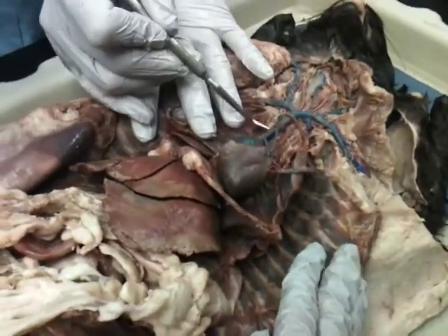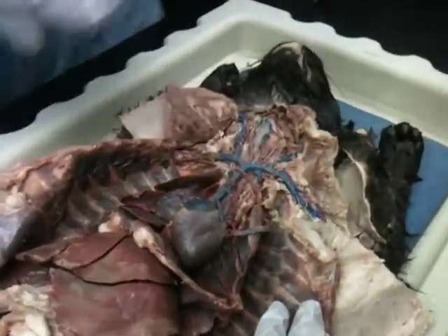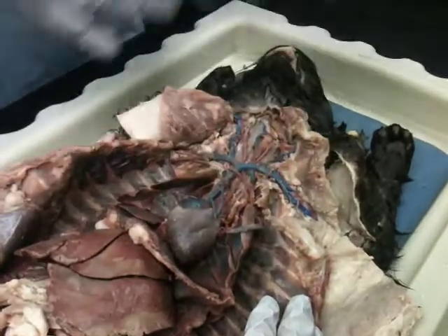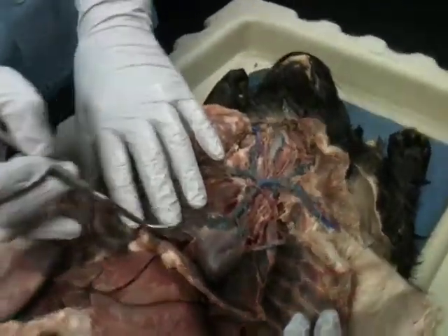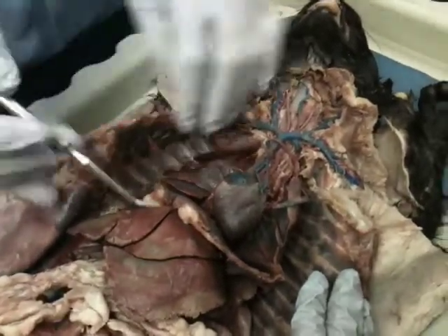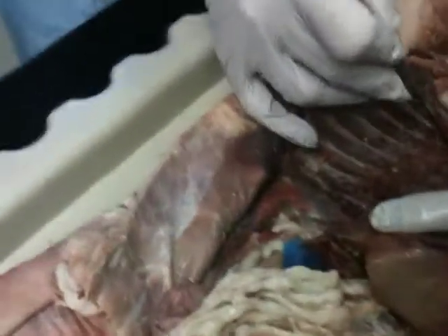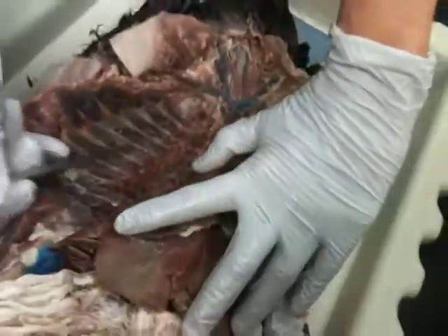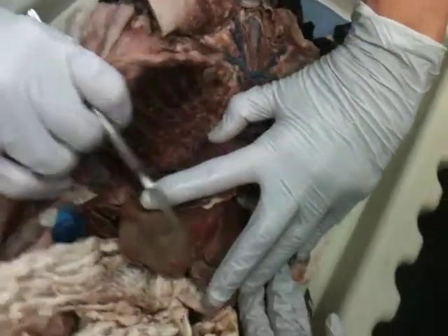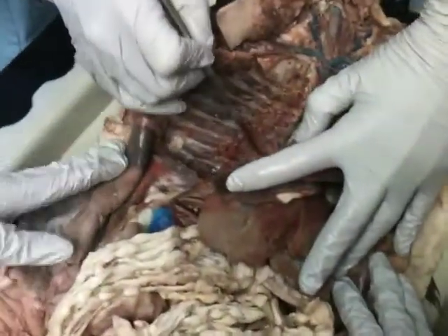So we have the superior vena cava. Everything is dumping into this area, even though I'm going to talk about it going the opposite direction. One of the first veins that goes into the superior vena cava is the azygos vein, only on the right side here. It will drain a lot of the vessels and the muscles, the intercostal muscles. So you can see that over there. The azygos vein right there.